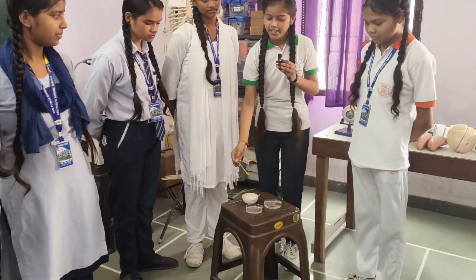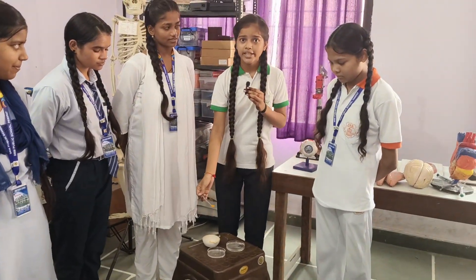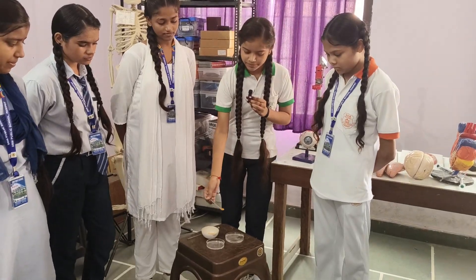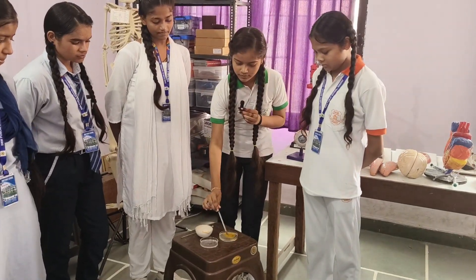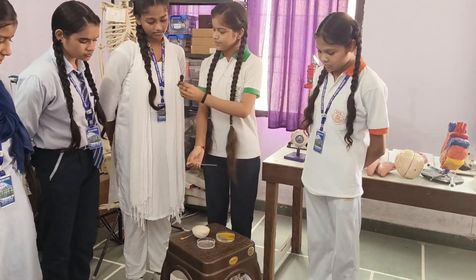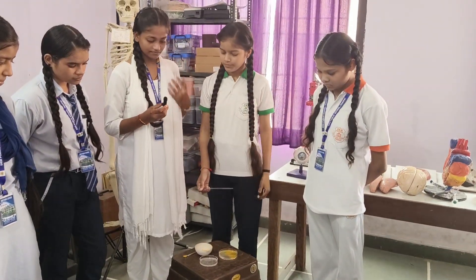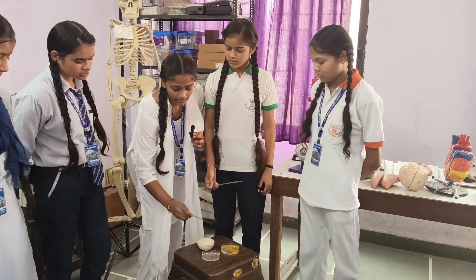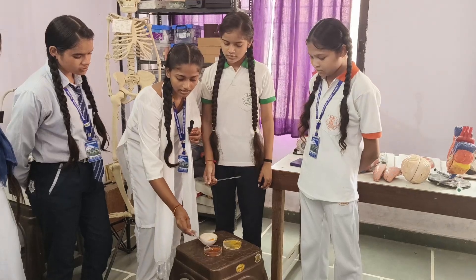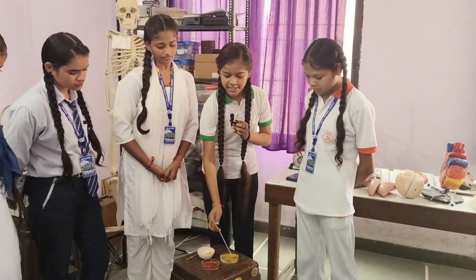This is turmeric. It is a natural indicator. We will check it in both solutions. Turmeric in base — there is a change in color, so this is called a base. This is not a change in color in acid.